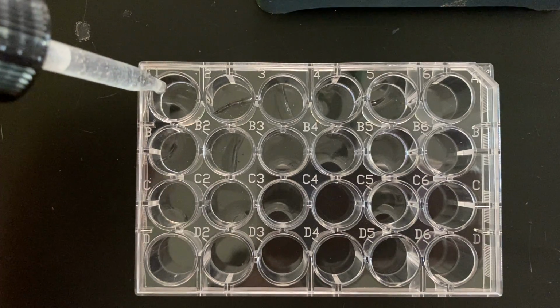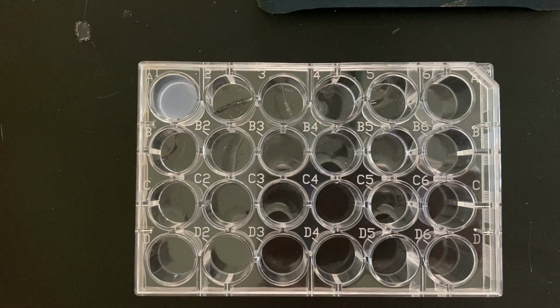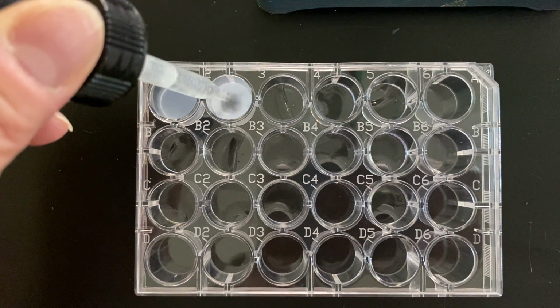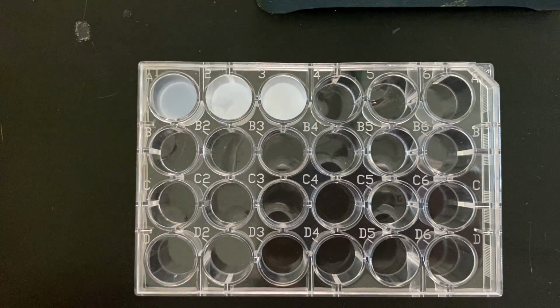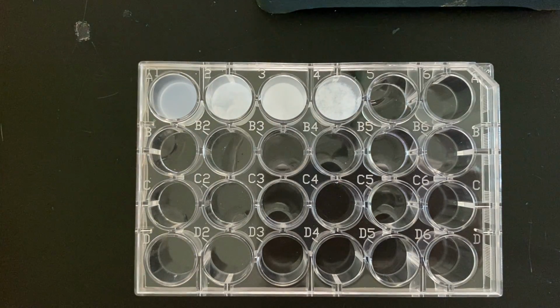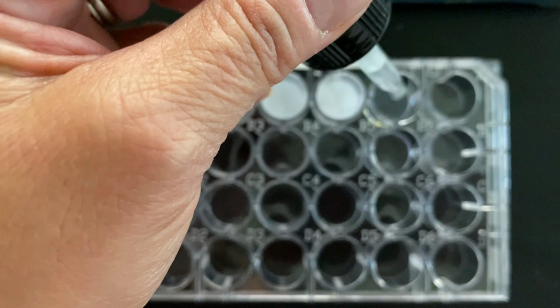So sodium carbonate going in with the calcium, going in with the magnesium, going in with the strontium, going in with the barium, and going in with our unknown.